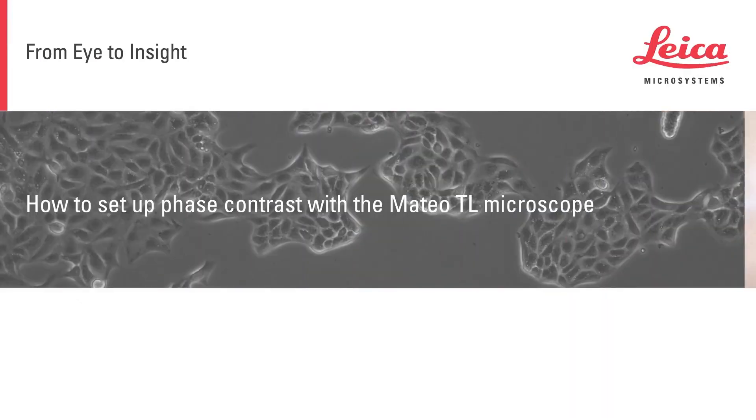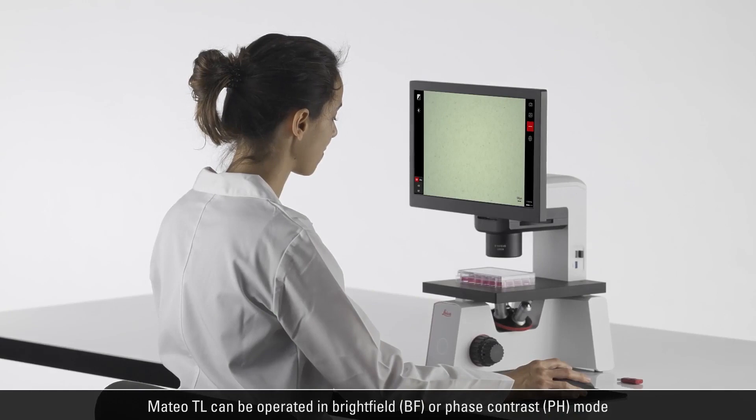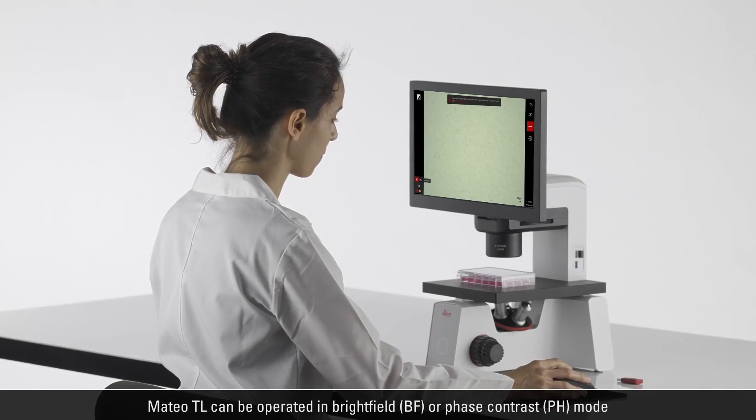How to set up phase contrast with the Mateo TL microscope. Mateo TL can be operated in brightfield (BF) or phase contrast (PH) mode.